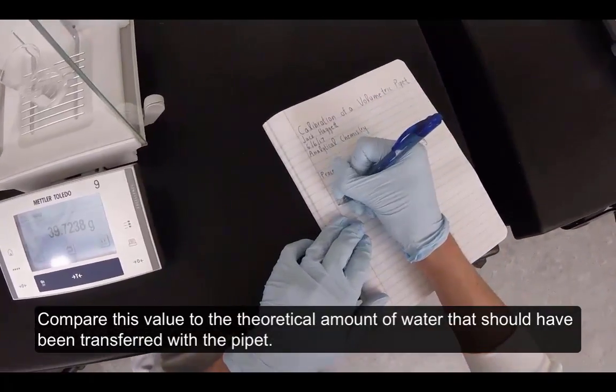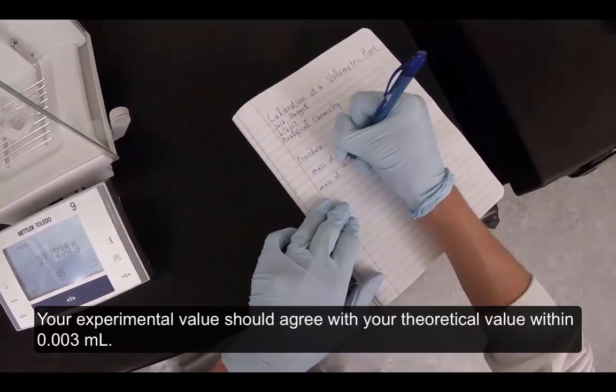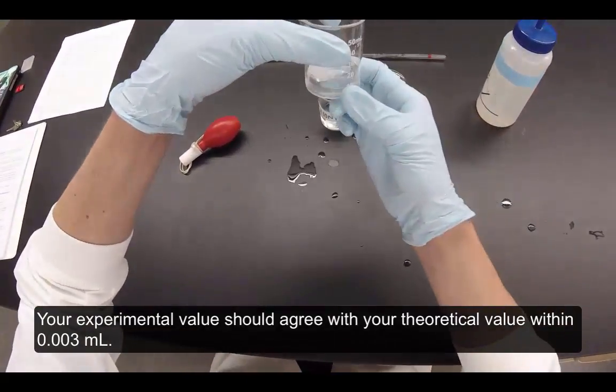Compare this value to the theoretical amount of water that should have been transferred with the pipette. Your experimental value should agree with your theoretical value within 0.003 milliliters.